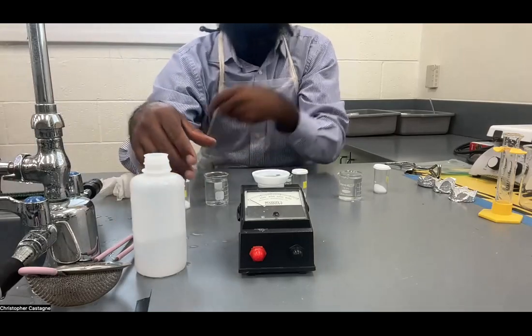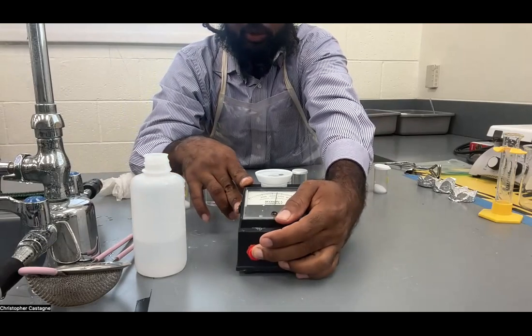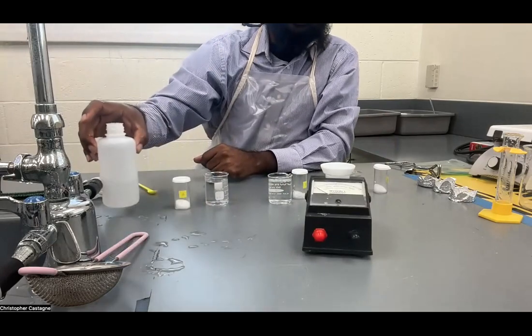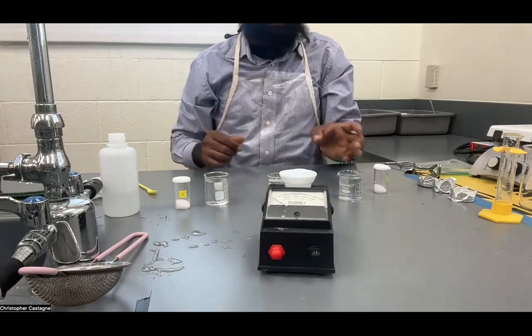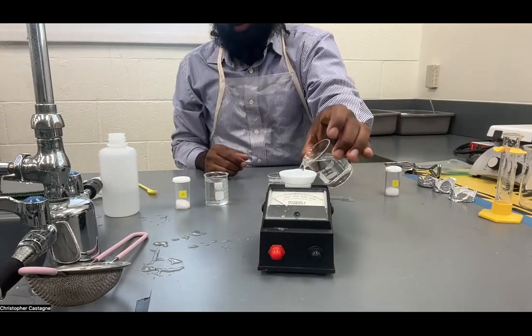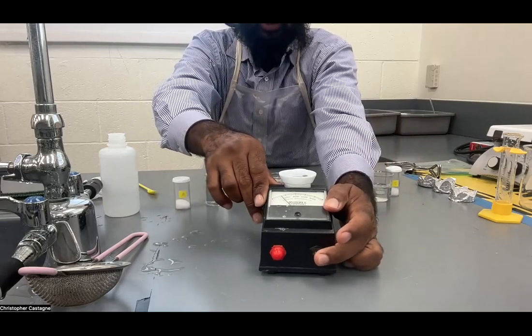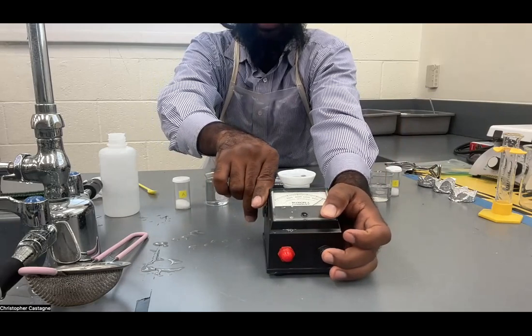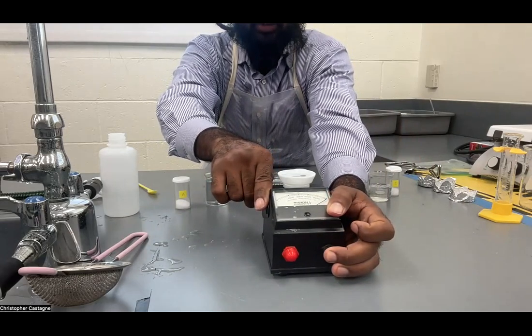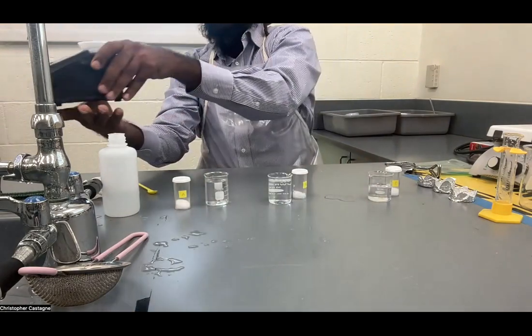I'm going to start with substance C. We pour enough to fill up the meter. The red button tests if it's working. The black button measures the conductivity, and it's going off the scale — it's a 10 on a 0 to 10 scale. So the solution of C is very conductive, it definitely conducts electricity.